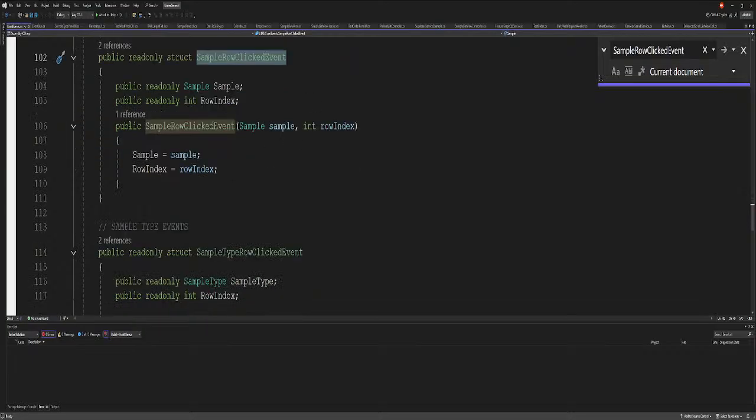And what that does is when we call this, it just sends to whoever is listening the sample and what row the index is in. I don't really care about the row index, but it's there for brevity. Okay, so now we update the sample panel.